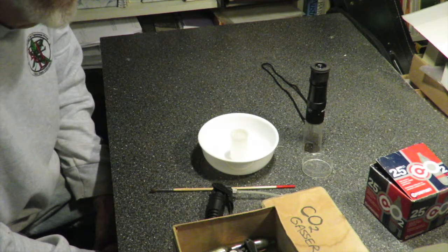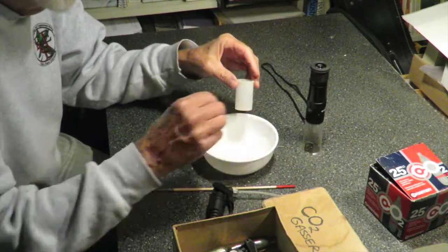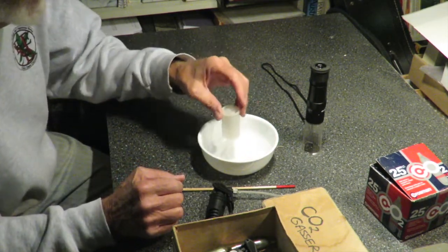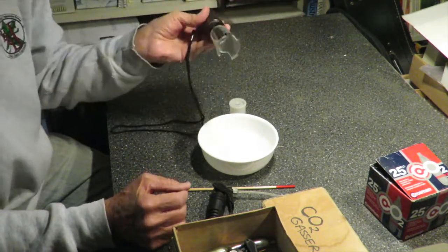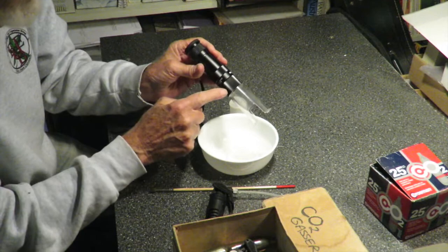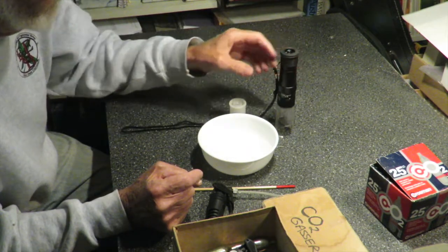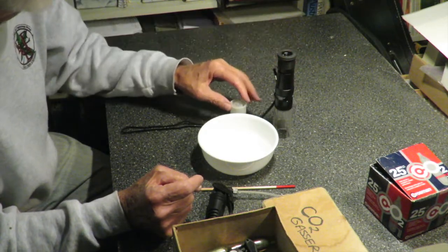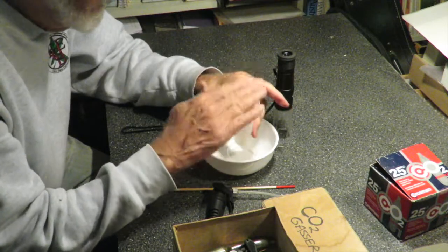Now what I'm going to do is release this anesthetized spider into a small petri dish that I'm going to use as a display background for an Orion monocular that has a close-up lens affixed to it, so that you can actually focus on something very close up. At the same magnification of the device, it gives a pretty good magnification effect. Alright, so I'm knocking the spider out now.